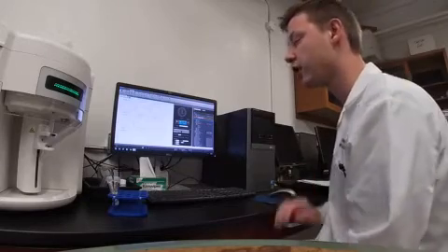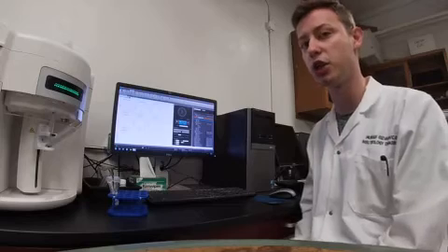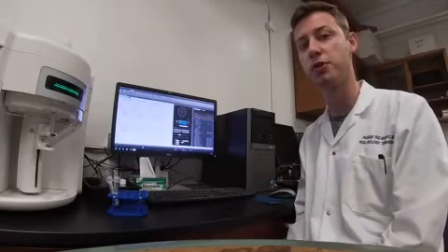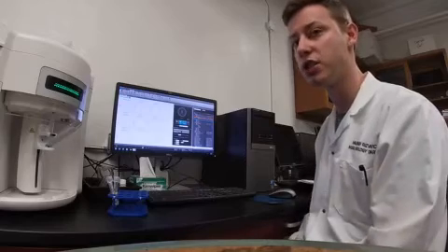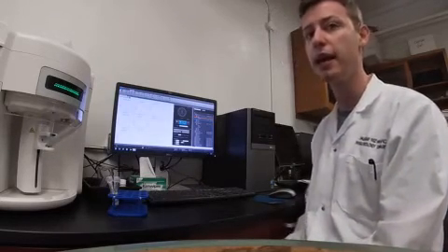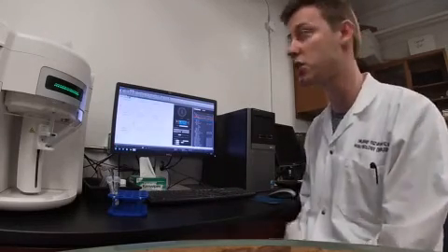Before you get started, you're going to want to run compensations. As you recall, we have 3 compensation groups for apoptosis and just 2 compensation groups for ROS. These compensations can be an unstained control group, or UC, and it could be one for each individual dye that you're going to be using in each experiment.